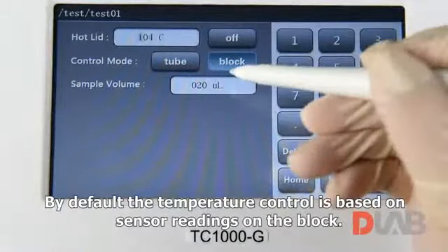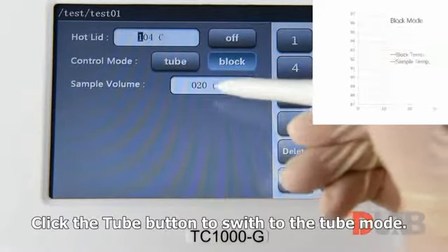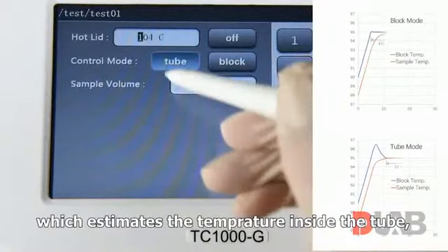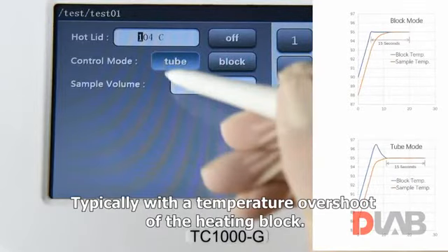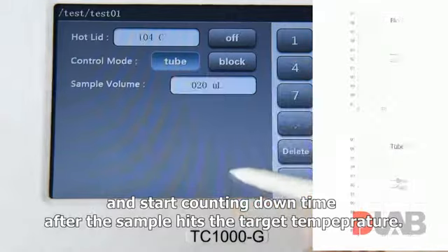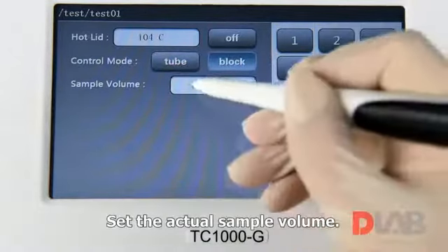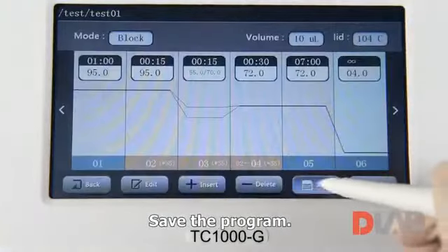By default, the temperature control is based on sensor readings on the block. Click the Tube button to switch to Tube mode, which estimates the temperature inside the tube, typically with the temperature overshoot of the heating block, and start counting down time after the sample hits the target temperature. Set the actual sample volume. Save the configuration. Save the program.